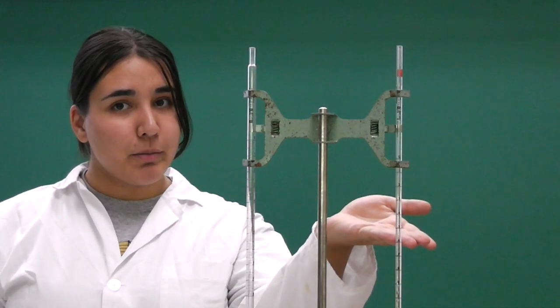These are the two mohr pipettes that you will encounter in the lab. You have a 1 milliliter mohr pipette and a 10 milliliter mohr pipette.